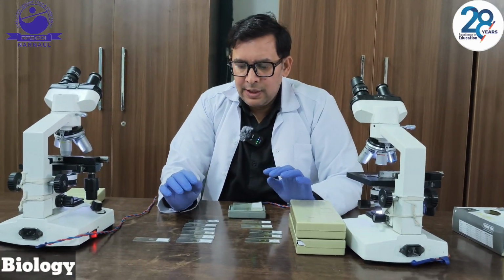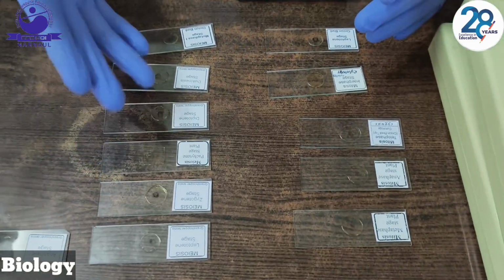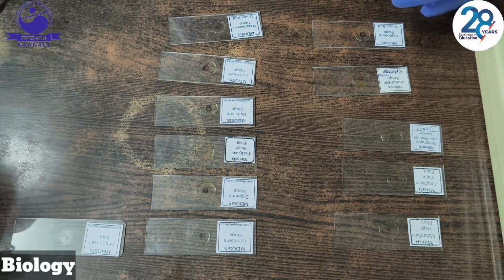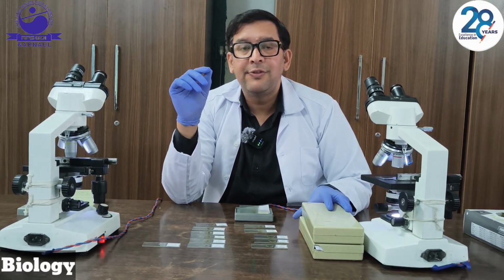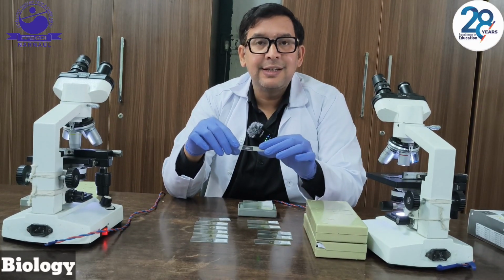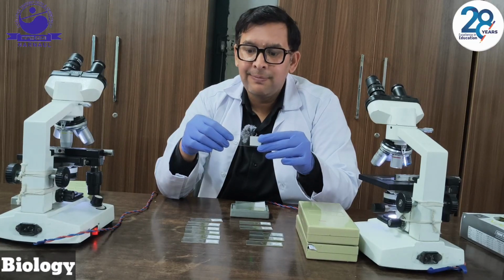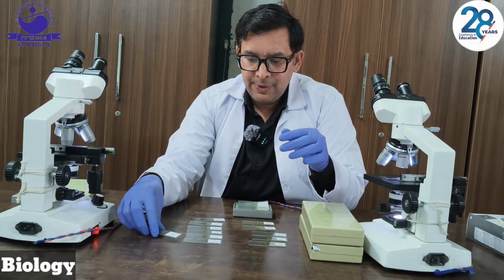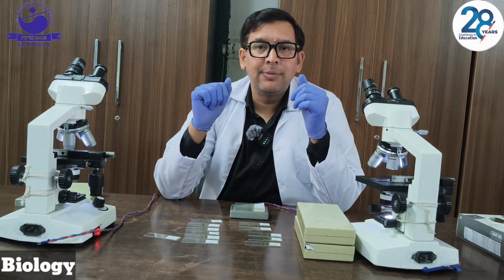Dear students, we have different slides. We have slides of mitosis and meiosis, which we are going to observe under the microscope. Before that, we have to consider a few precautions. Handle these slides with care, as they are permanent slides and they may get damaged if used roughly. Wear gloves so that they can protect us. Now, one by one, we are going to start to observe this under the microscope.